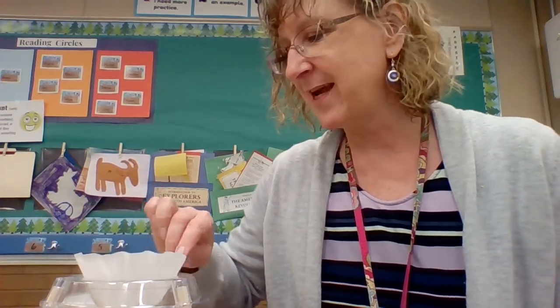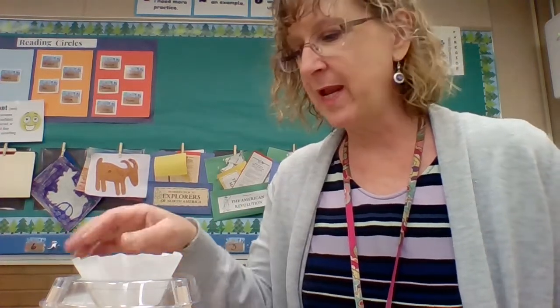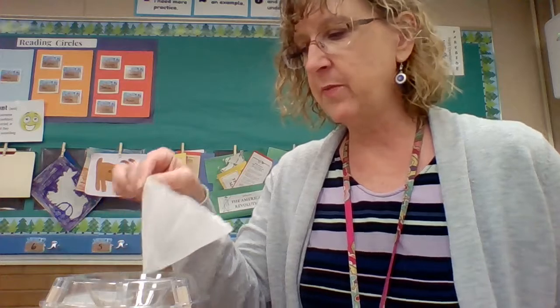On those last few little drops out there. All right, I'm going to let that drain for just a minute. I'll be back. All right, that's finished draining. We pull this out. I'm going to put it on a paper towel just to protect the surface, particularly of my computer, as I open this up.